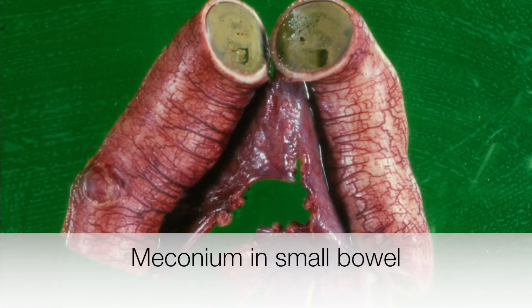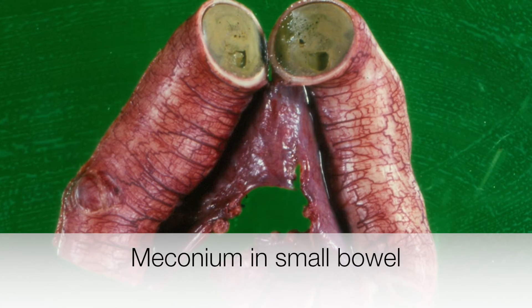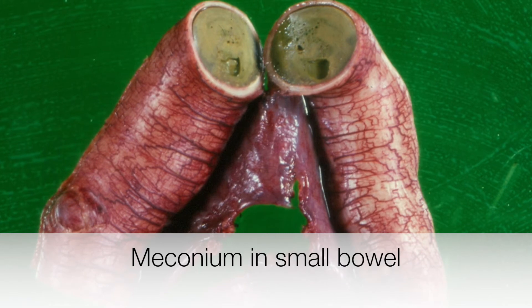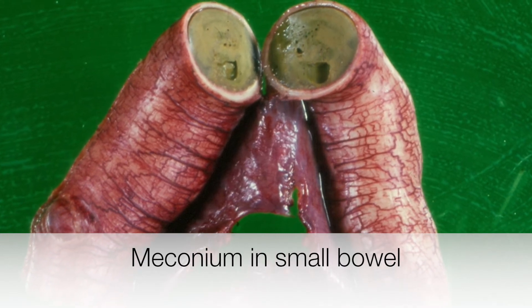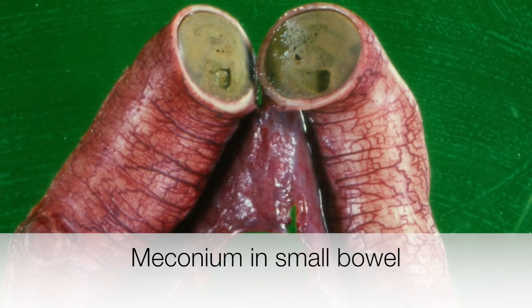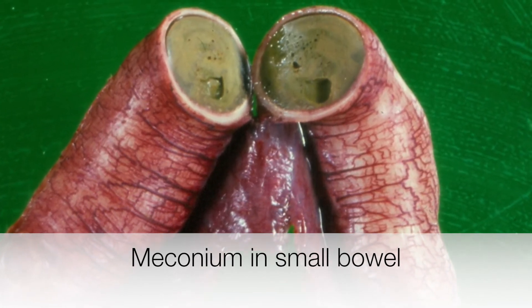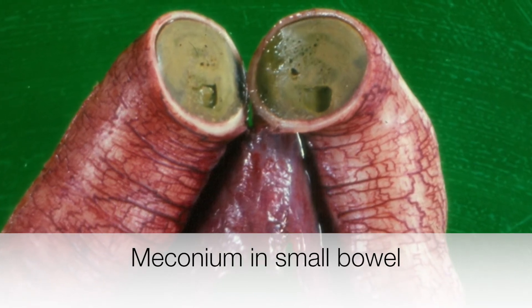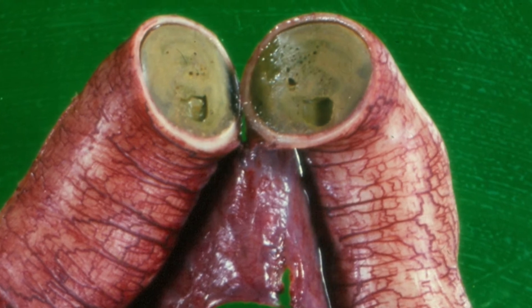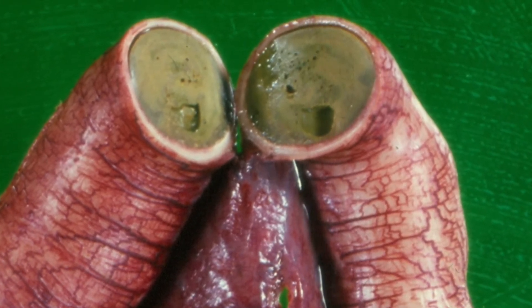Before we look at an example of meconium periorchitis, this is a piece of small bowel from a baby that contains this greenish material — this is meconium. And if the bowel perforates, for example due to obstruction, the meconium enters the abdominal cavity causing a peritonitis. Over time the meconium and inflammatory infiltrate will become organised into fibrous and calcified tissue.